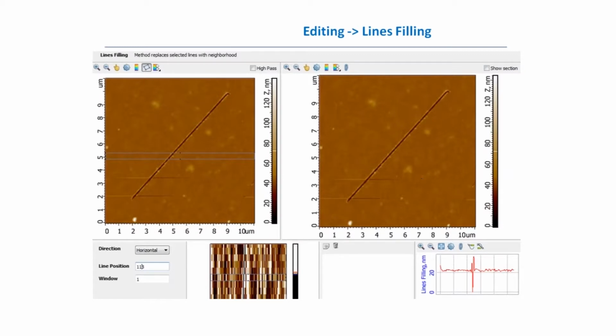Another very common artifact in atomic force microscopy is so-called line spikes. In this image you see a pretty nice image of a scratch, but we can see two line spikes which could happen due to different reasons. Now our aim is to eliminate them. You can use the line filling method, which is in the section editing of image analysis. From the left side we have the original scan and the moving window, which we can position to our line spike using the line position input box.